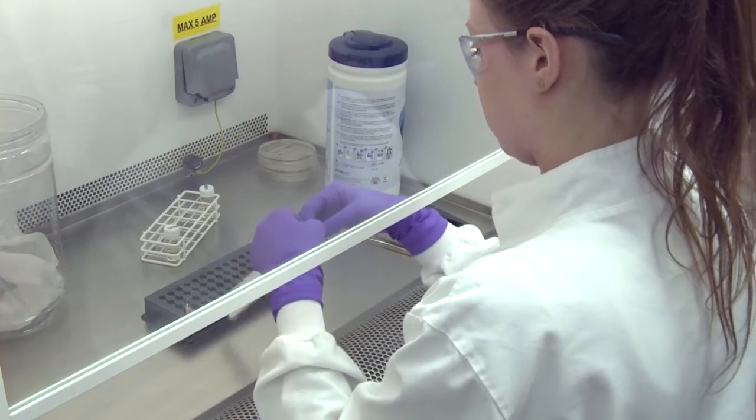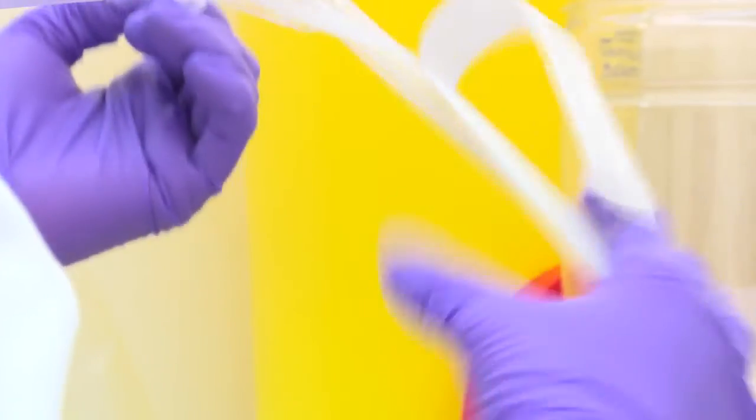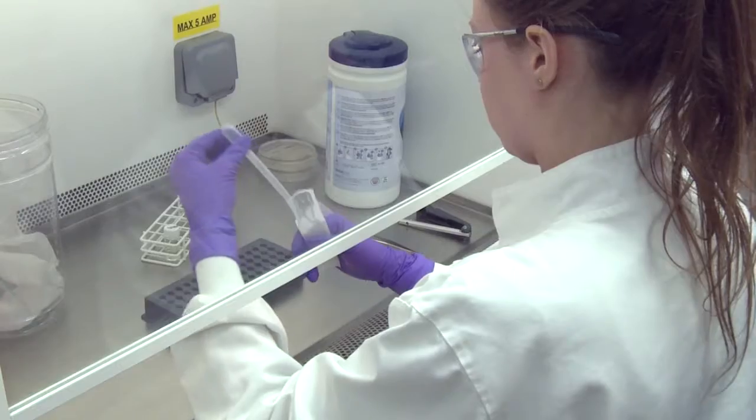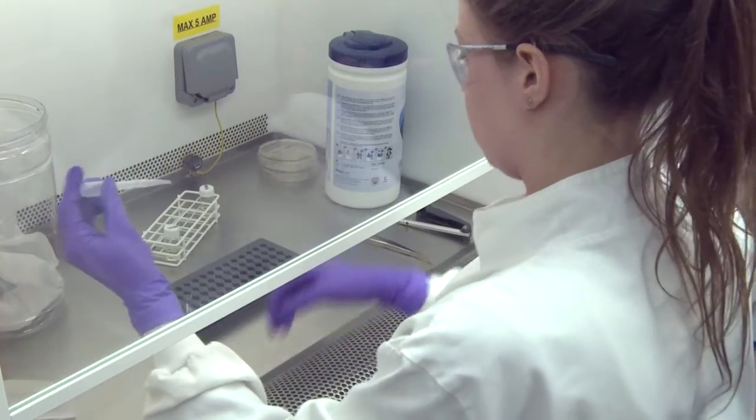To reconstitute, transfer approximately 0.5 millilitres of broth, when required enriched with blood, to the ampoule.